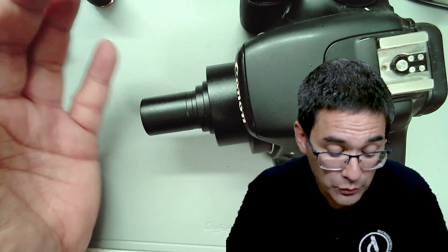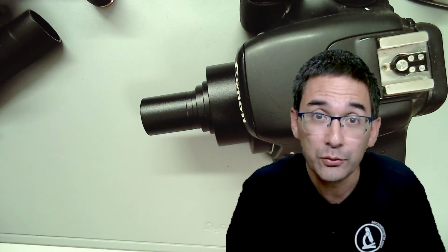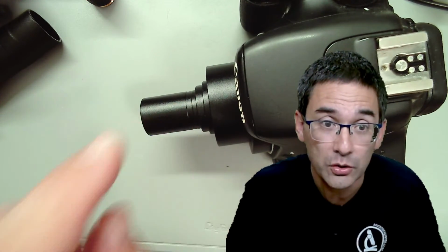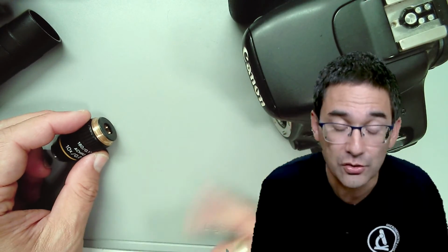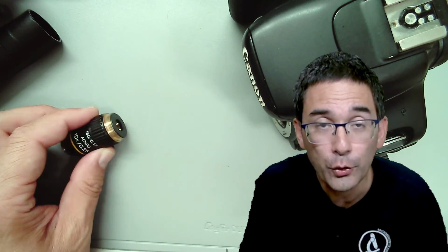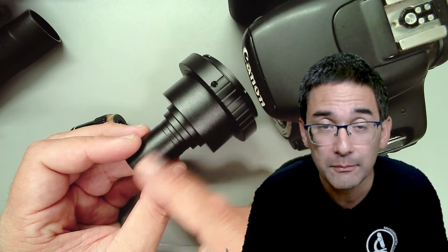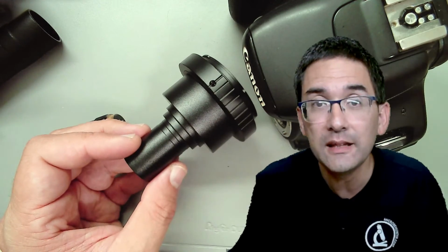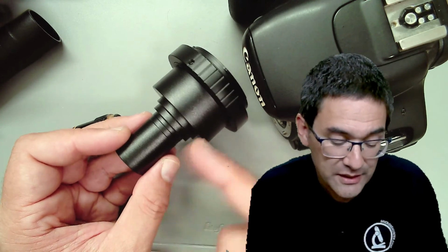If you're really into photography and artistic photography, and you really want to have high quality, then you have to get yourself a good objective, and you have to try to directly project the image from the objective. You have to make a direct projection onto the sensor, so the distances have to be correct. Then you only have the lens errors of the objective. Generally every optical system that you have in the light path will degrade the image quality to a certain extent. There are internal reflections, there are aberrations, and so on. So this is always a disadvantage.